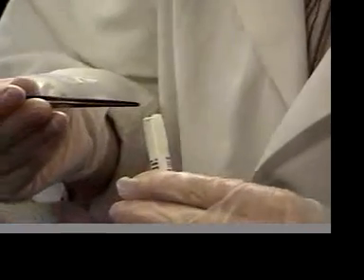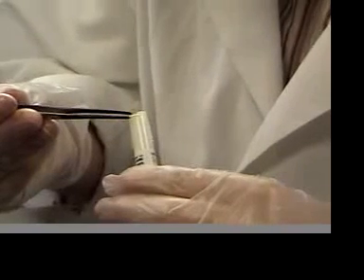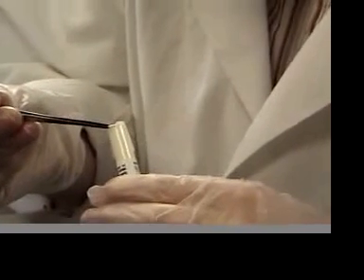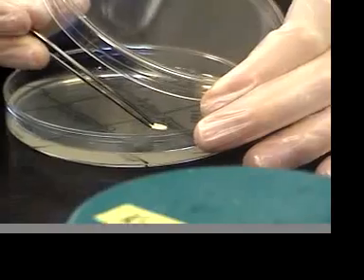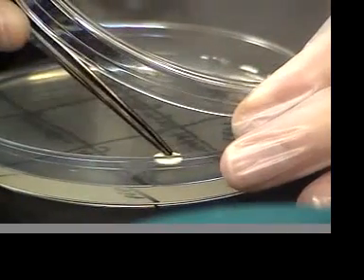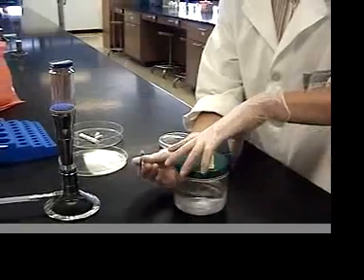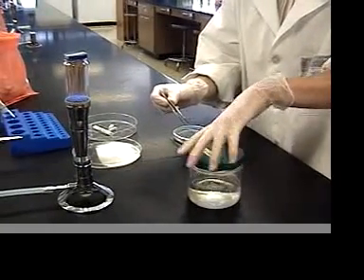You should be able to reach in and push the disc to one side, grabbing from the other side, and placing that disc onto the agar plate. Press down with your forceps in order to ensure that the antibiotic disc sticks to the agar.